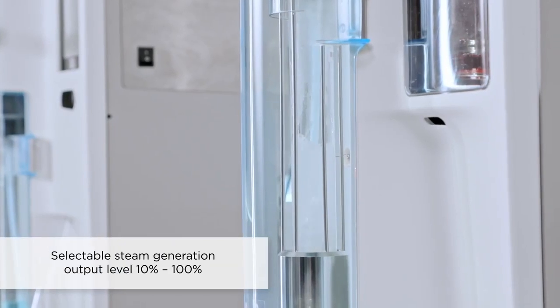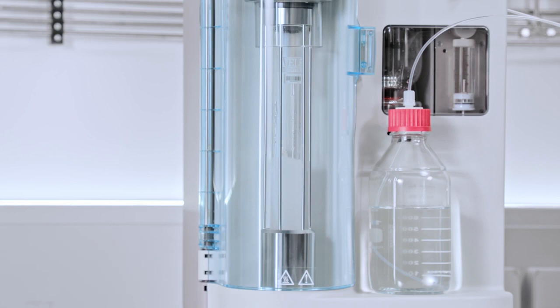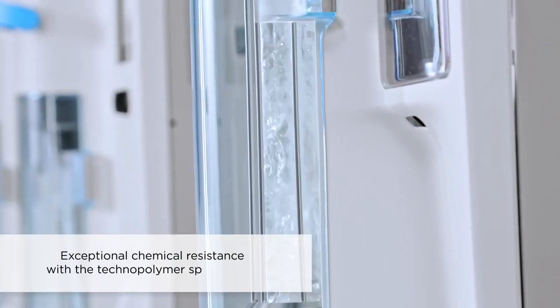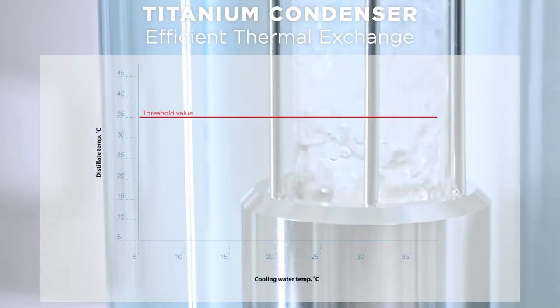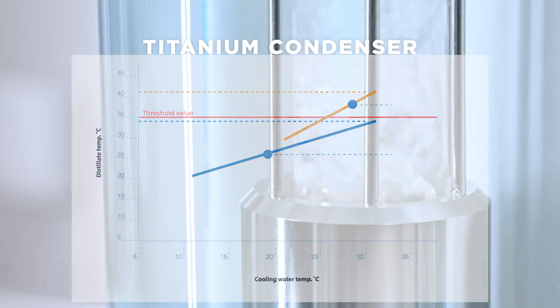The powerful steam flow with variable steam output ensures maximum versatility for any application requirement, powered by the exclusive VELP steam generator. The technopolymer splash head guarantees exceptional chemical resistance and allows ammonia to proceed for condensation. A unique titanium condenser guarantees efficient thermal exchange and low water consumption for a total nitrogen recovery.